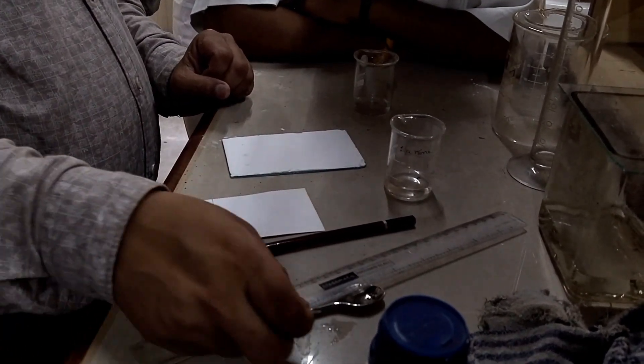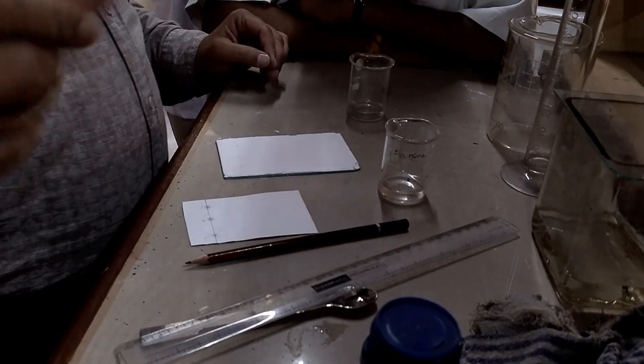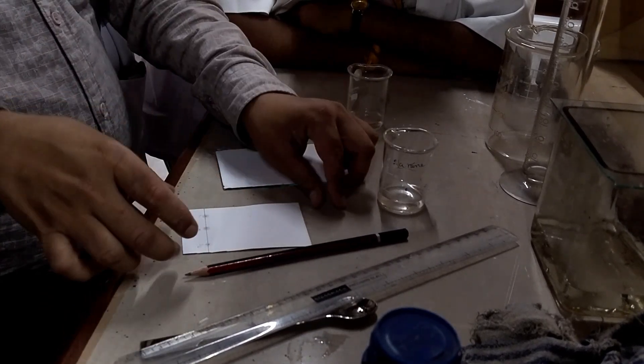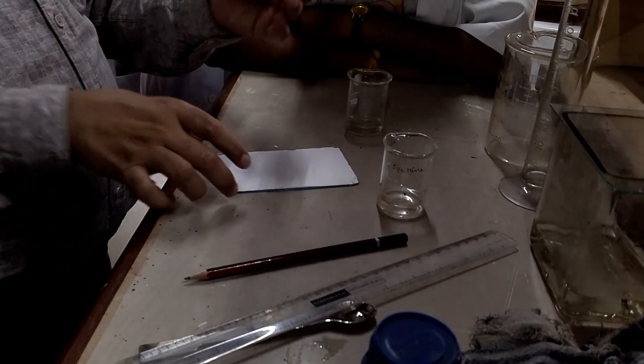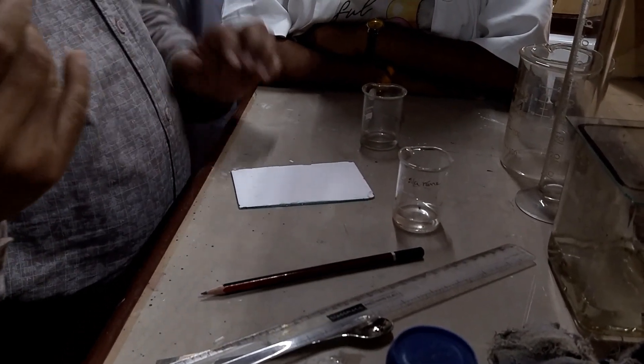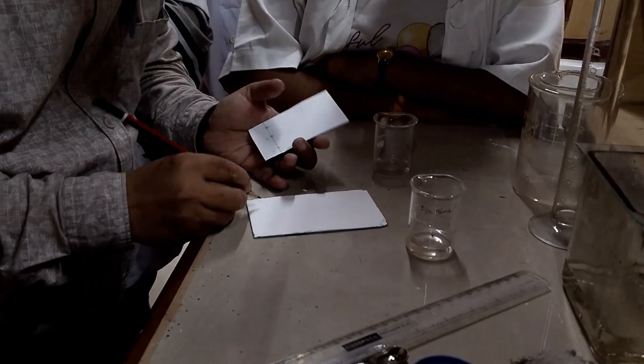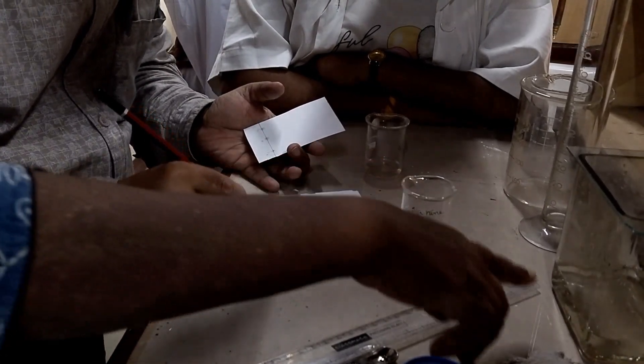In most cases, for the sake of identification, we put the sample — which is a mixture — at the center, and the pure components are also spotted. So by measuring the height of travel, we can identify the samples. In this experiment, we are not doing that. Again, he is putting that line — you can see. And once the samples are deposited on the plate, there will be some residual solvent that has to be removed.